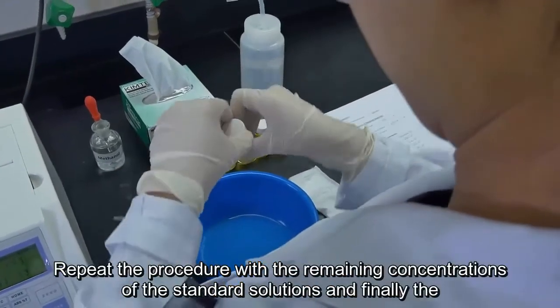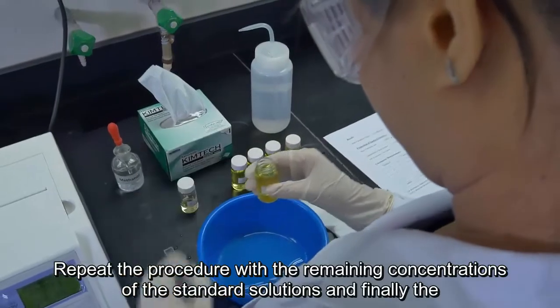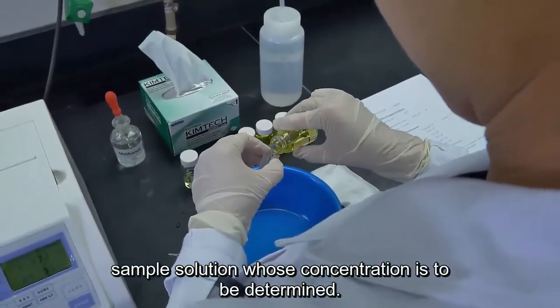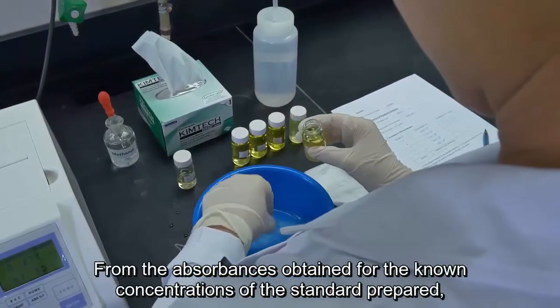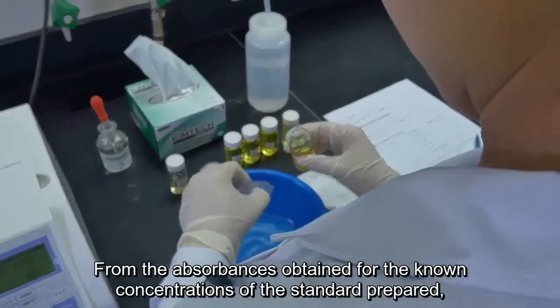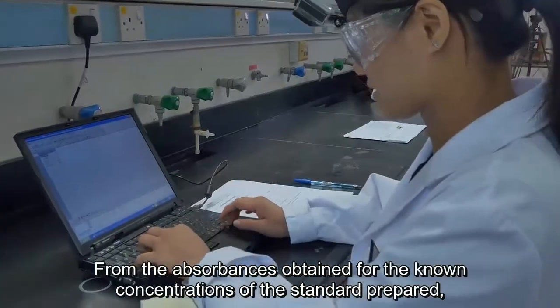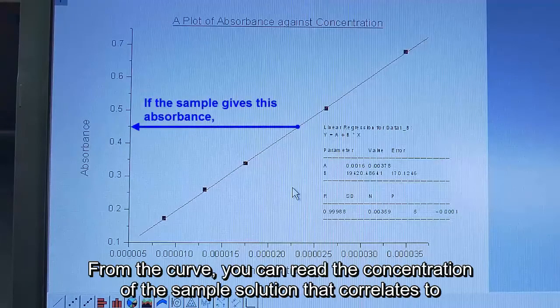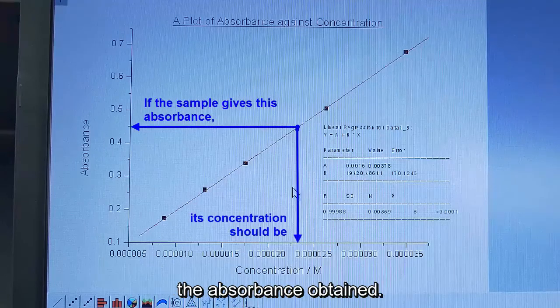Repeat the procedures with the remaining concentrations of the standard solutions and finally the sample solution whose concentration is to be determined. From the absorbances obtained for the known concentrations of the standard prepared, a calibration curve can be constructed. From the curve, you can read the concentration of the sample solution that correlates to the absorbance obtained.